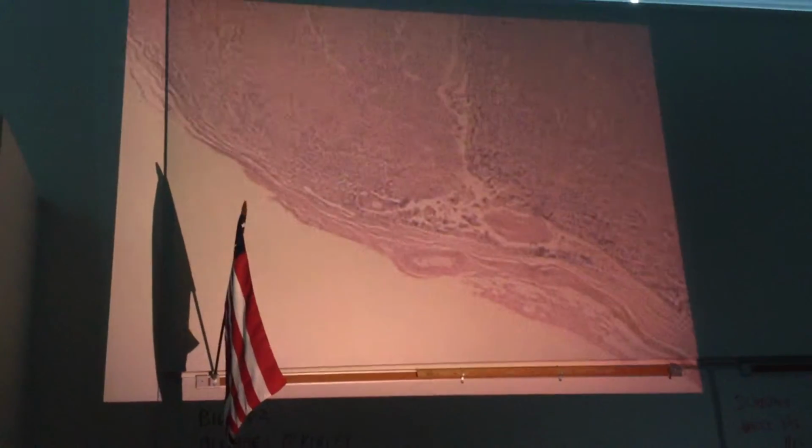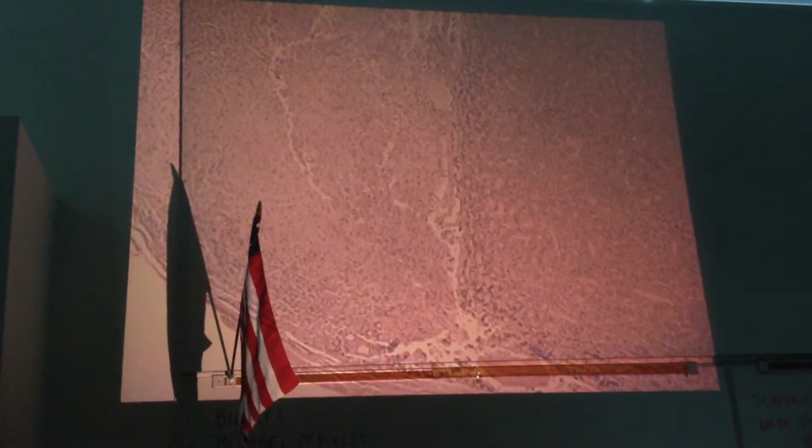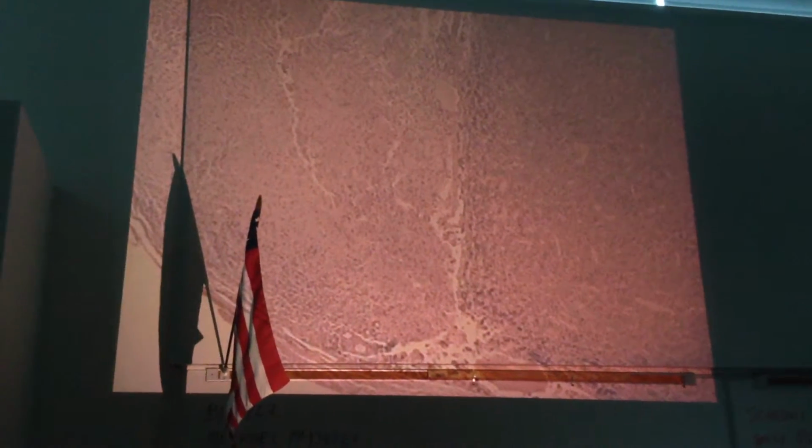So anterior pituitary and posterior pituitary. Here, there's a dividing line between them. Anterior is over on this side, posterior is on that side. The distinguishing feature is the anterior pituitary is replete with blood vessels. So you're going to see small blood vessels that have ghosts of red blood cells in them. The posterior pituitary is just ends of neurons and connective tissue. And so you don't see a lot of blood vessels there, and you see a lot of connective tissue with elongated nuclei present in the connective tissue cells.